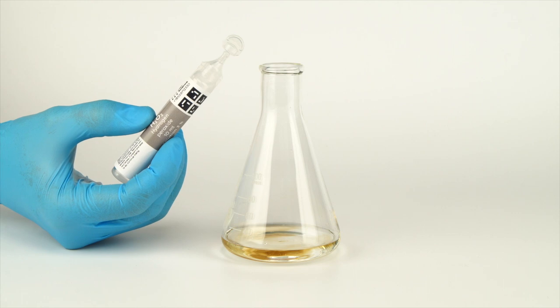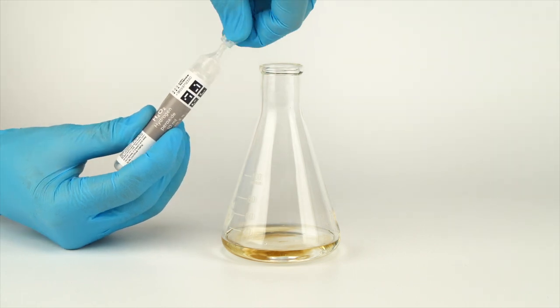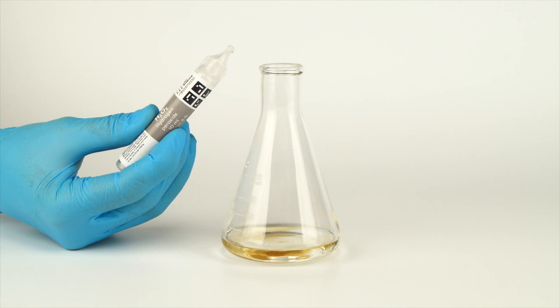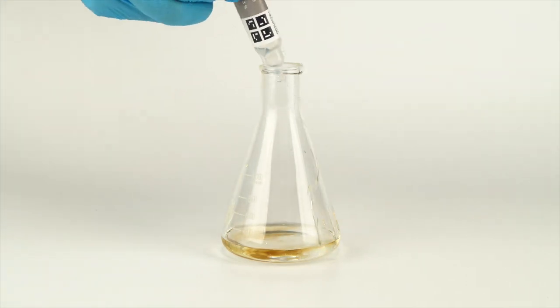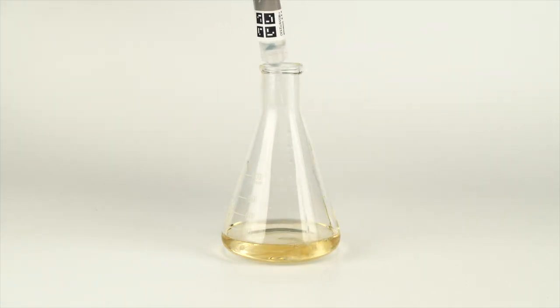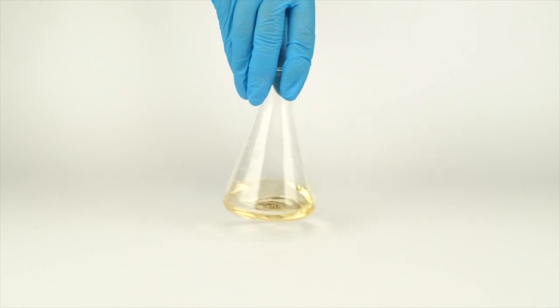Next, add an oxidizer. Open the bottle of hydrogen peroxide by unscrewing the plastic lid. Add the whole bottle to your mixture. Mix the solution.